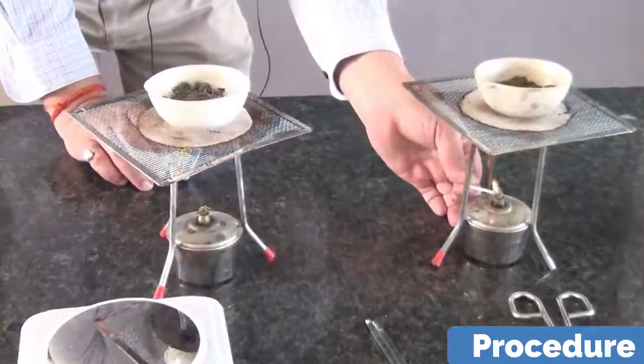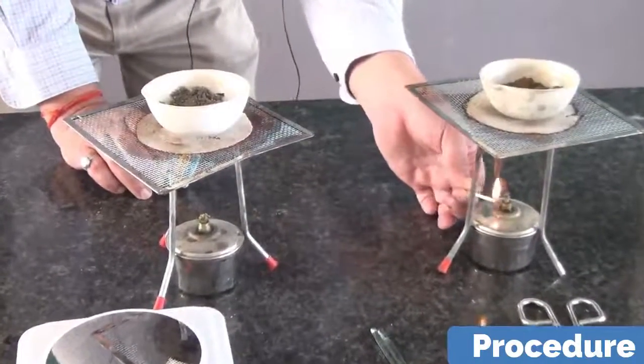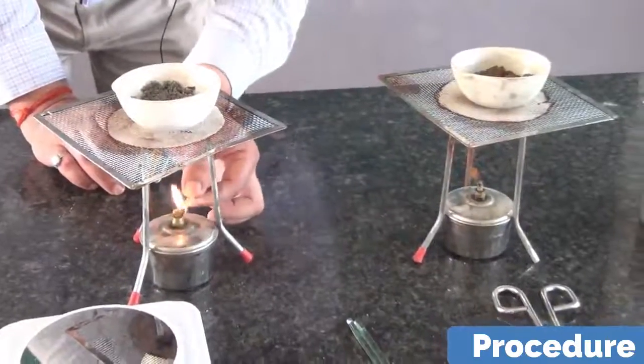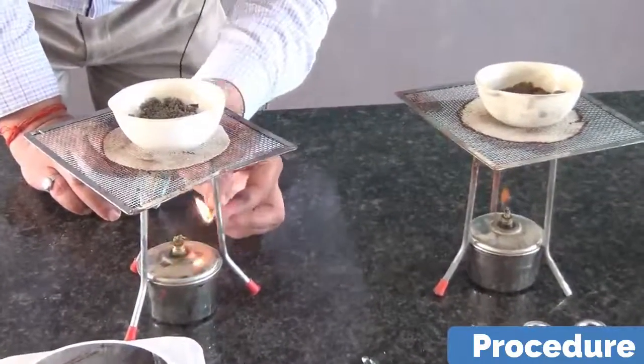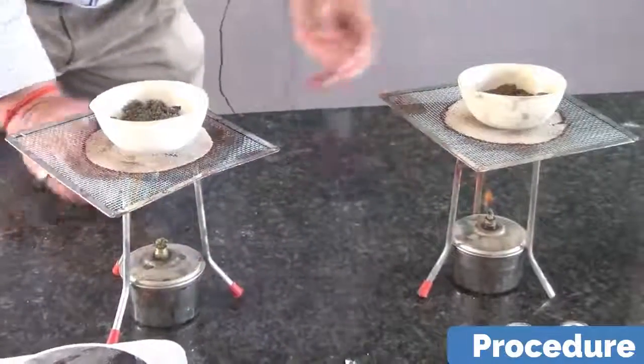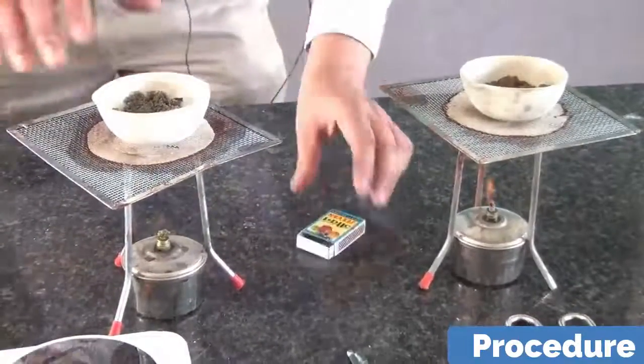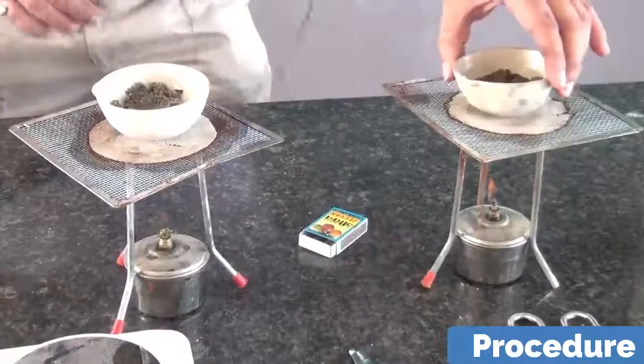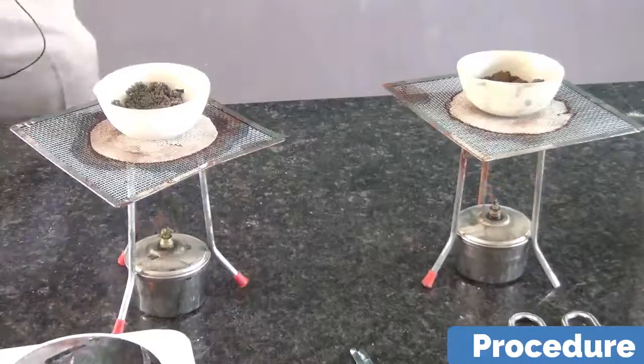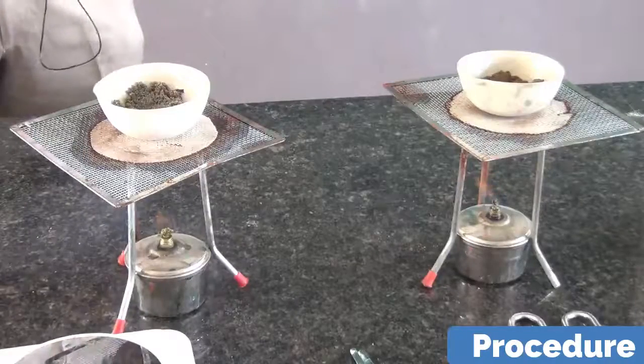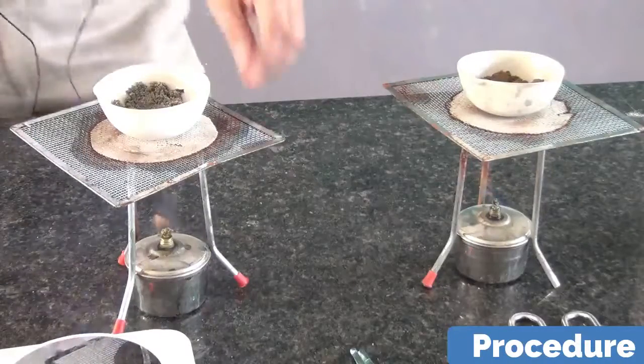Naturally we will be heating them and we will ascertain that all the water which is present in them goes out, is evaporated, because it is actually the theme of the experiment. We have to calculate the water content. So naturally we are going to heat it for about 10 minutes.